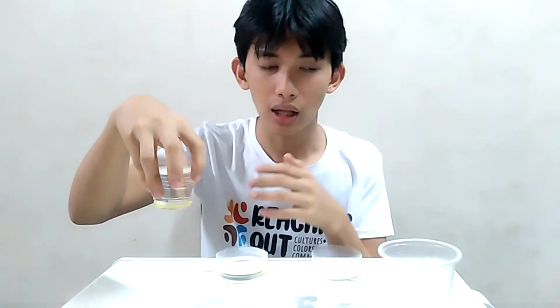Oil and isopropyl alcohol have a similar density, and they are compounds similar in molecules that can easily dissolve each other. And because of that, as you can also see, the alcohol has enough similarities and polarities with the oil. That is why they are soluble.